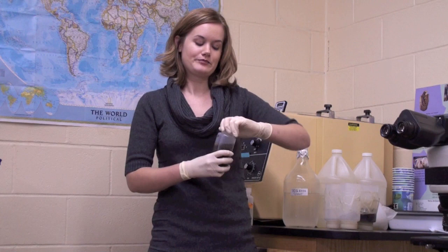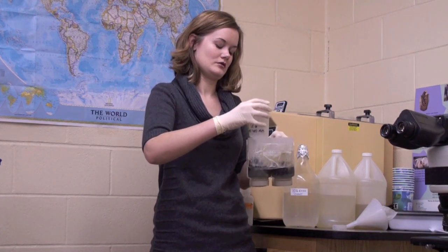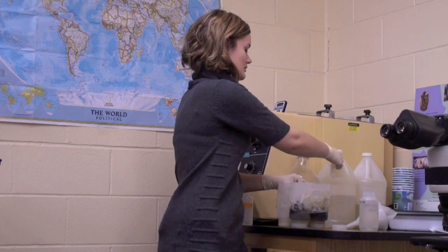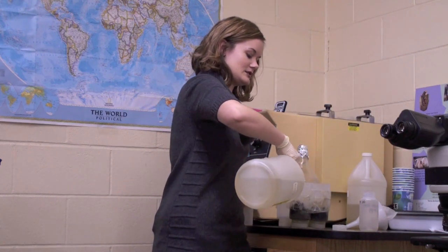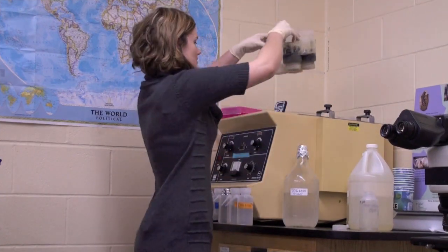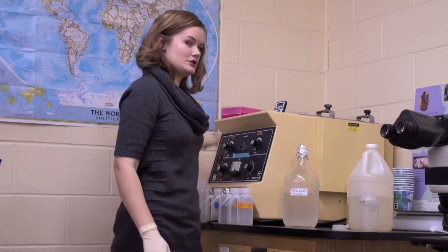This test that we do is a detection test for varroa mites. So when I get your sample, I put it in a series of tubes that have been cut in half and then I fill it halfway with alcohol right over the alcohol that's already been in your sample that you've sent. Then we have a shaker here that we're going to put our tubes in, set the timer for an hour and then turn it on.